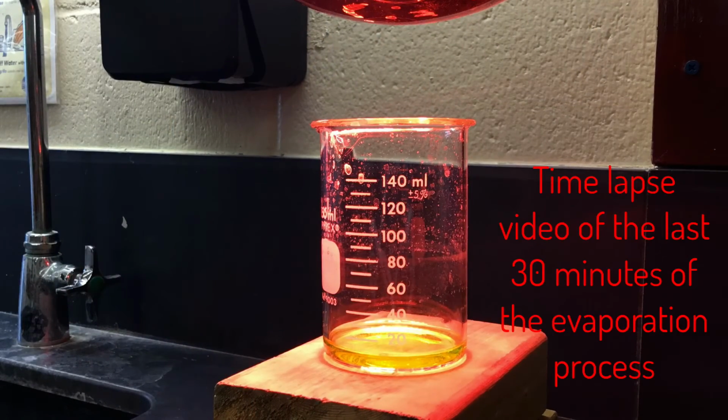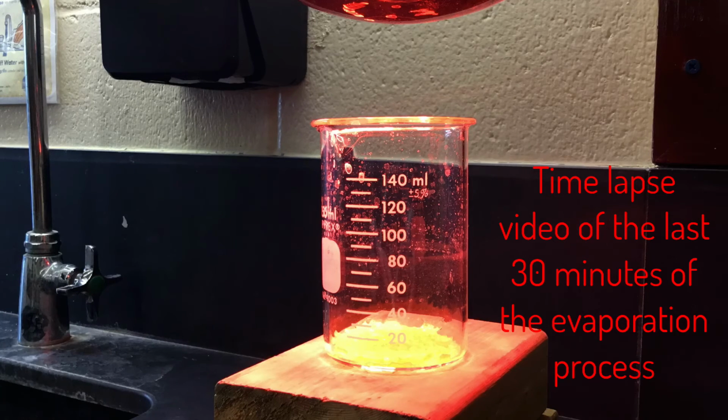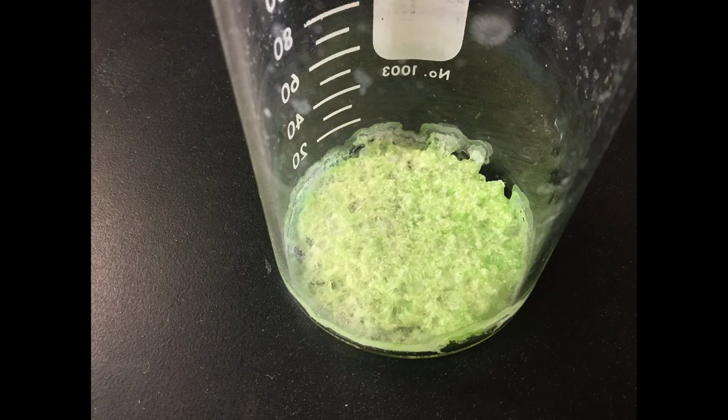We will evaporate off all of the water from the solution and we'll be left with another solid that is the second product of our reaction. Here is that second product, sodium nitrate, after all of the water has been evaporated.